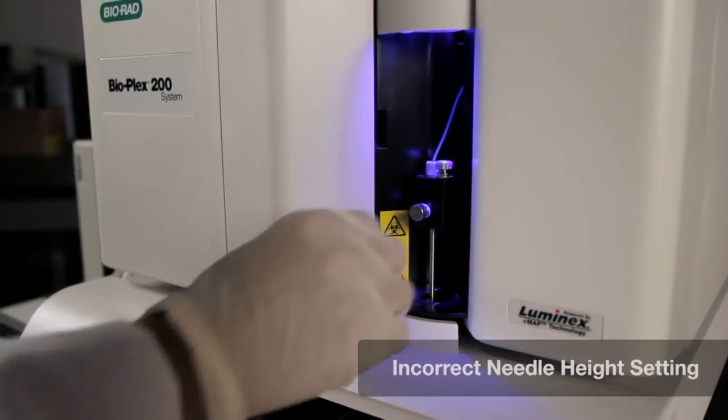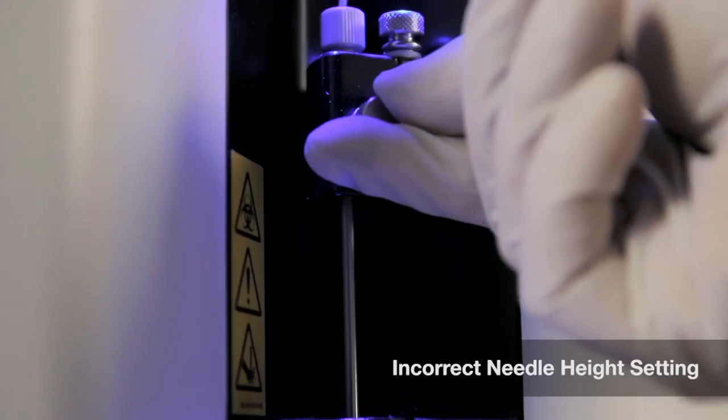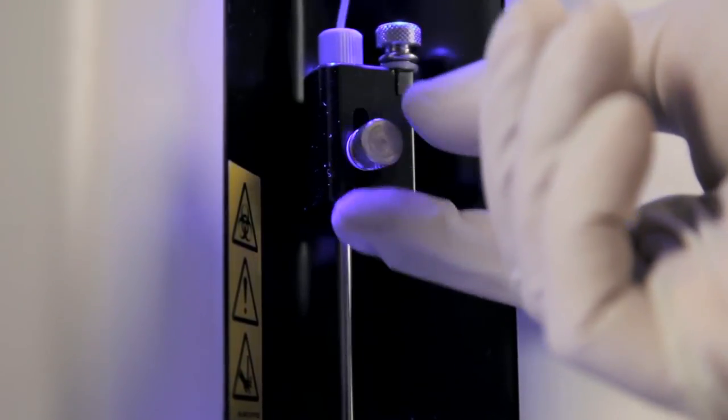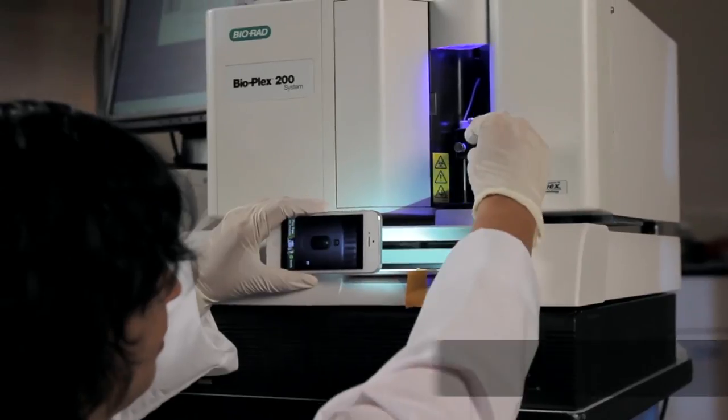Another possible cause of the error is incorrect needle height setting. The error message will appear if the sample needle is set too low for the plate being used or if the needle is not centered over the well.